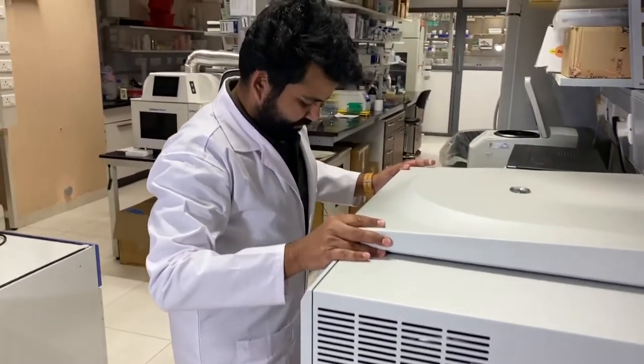That technique is called expansion microscopy. You can ask Simran or Pravar about it. Expansion microscopy achieves super-resolution not achievable by conventional microscopes. What it does is physically expand the cell or specimen so that we can achieve greater resolution.